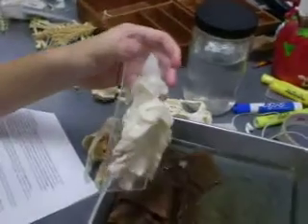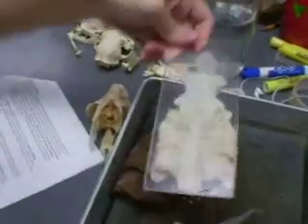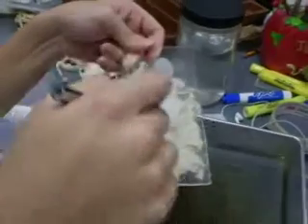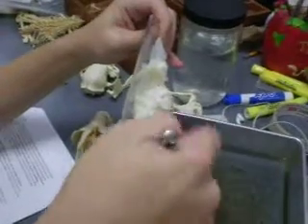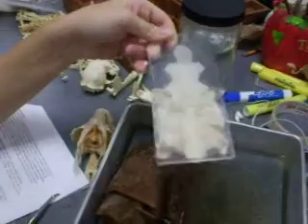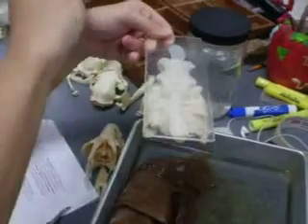This is the orange shark. This is the dorsal side, and this is the ventral side. So if your shark were alive, it would go like this — because this is the jaws.